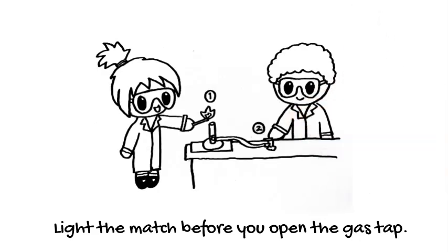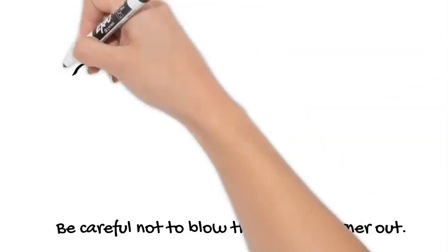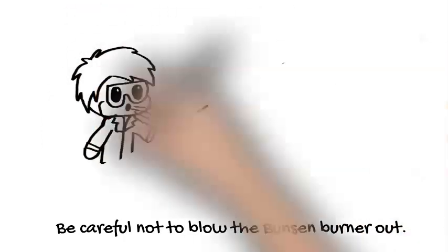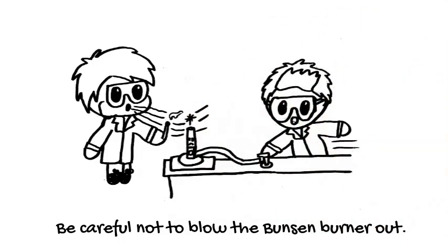You might like to have two people do this as a team. Be careful with how you extinguish your match. If you blow it out, you could accidentally blow out the Bunsen burner as well. Face away from the Bunsen burner or just flick the match to extinguish it.